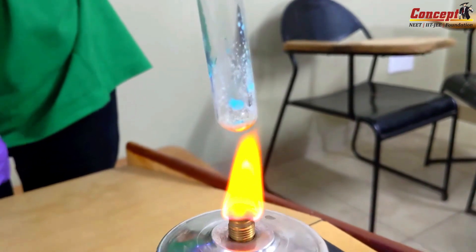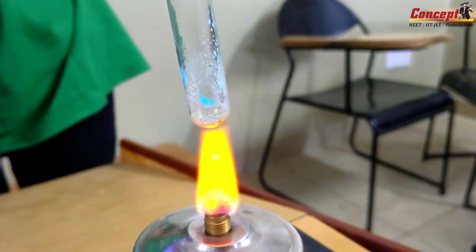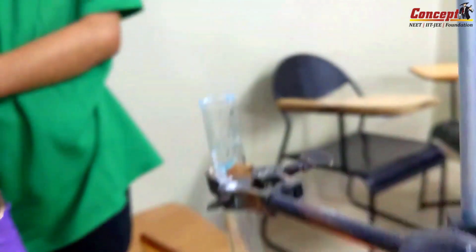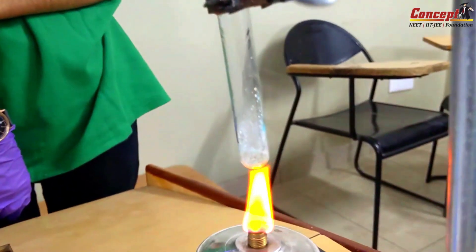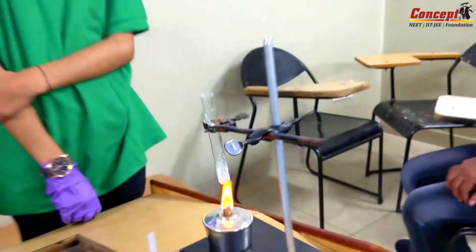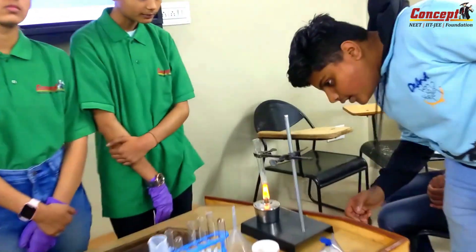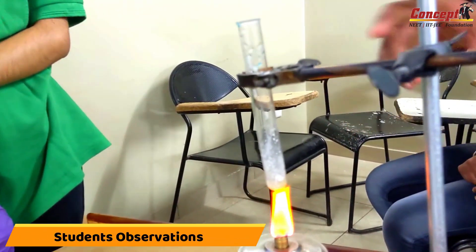Slowly all the crystals are converting into white. This is nothing but water vapor, so one by one just have a look. Do you see any white color? Yes sir, the color has changed from blue to white.